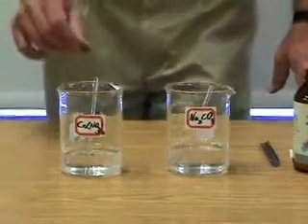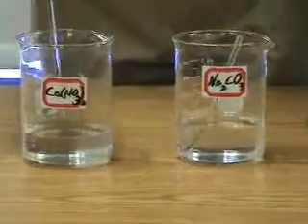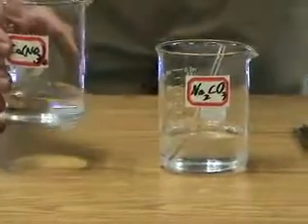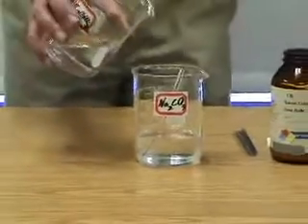As you can see, the two salts now are fully dissociated. There are no solids left in either beaker. And I'm going to pour the calcium nitrate into the sodium carbonate.